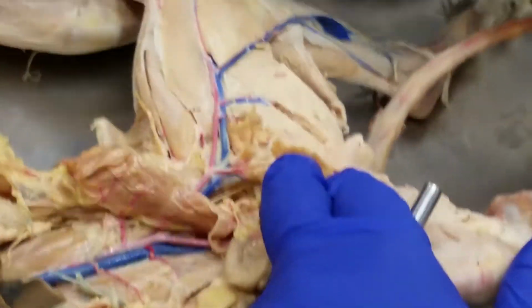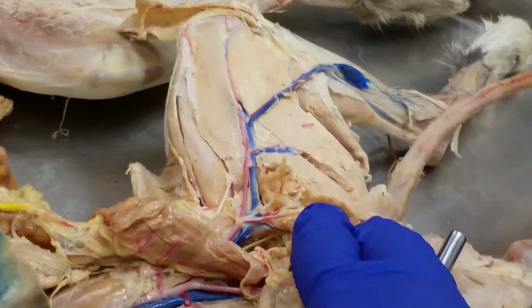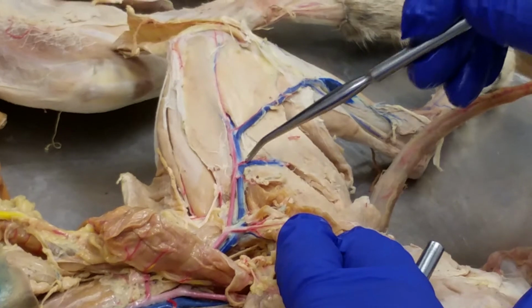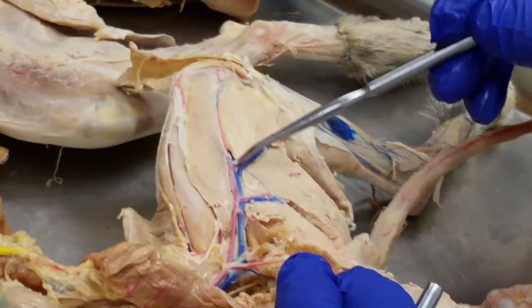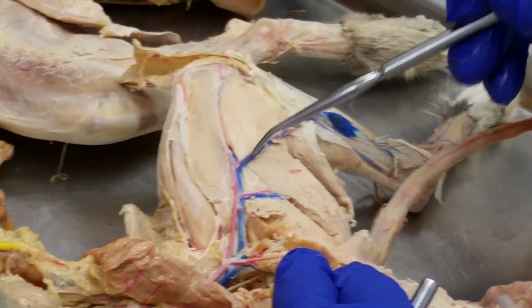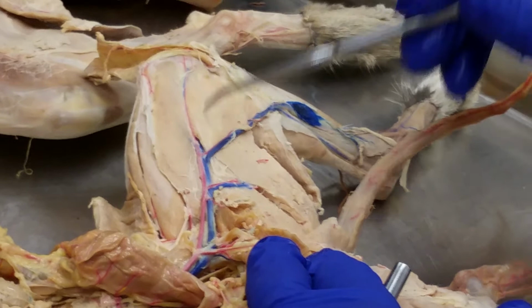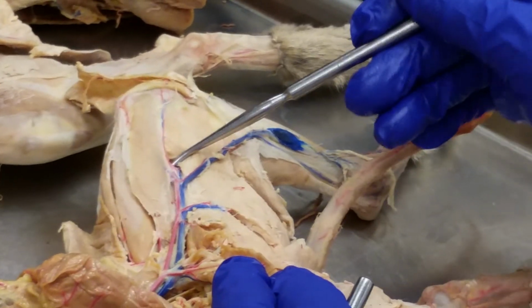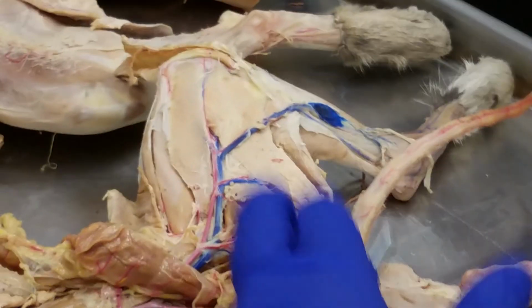When you go down here, okay, this is the femoral artery and vein. Okay, yeah, this one is not on the list here. There's the proximal femoral artery and vein, but femoral artery and vein, and then here splits into the saphenous artery and vein. Okay, and then here is the popliteal artery and vein goes to the knee, and that's it.